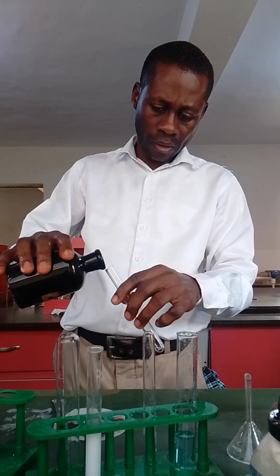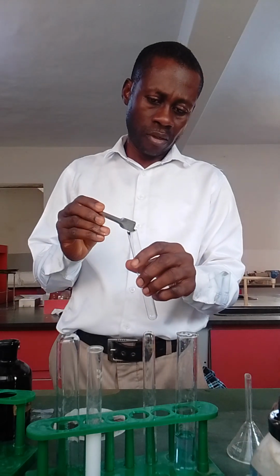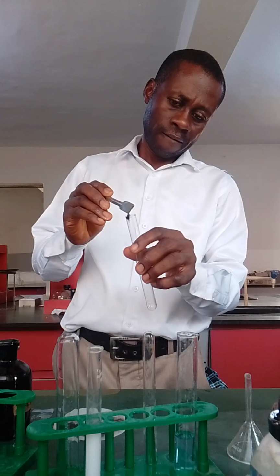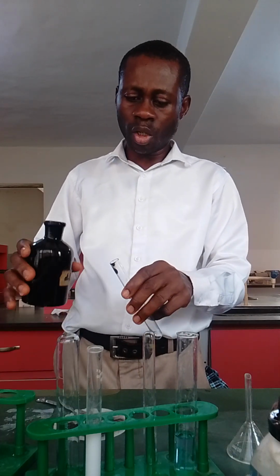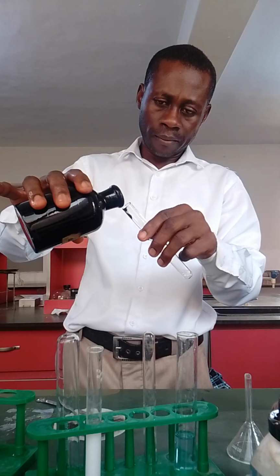Let's see what happened. Okay, let me take just the residue, add the residue, let it fall inside so that it can give you what you need. So far it hasn't gone, so make sure that the dilute acid touches it. All right, you see what I'm doing? So let's see.